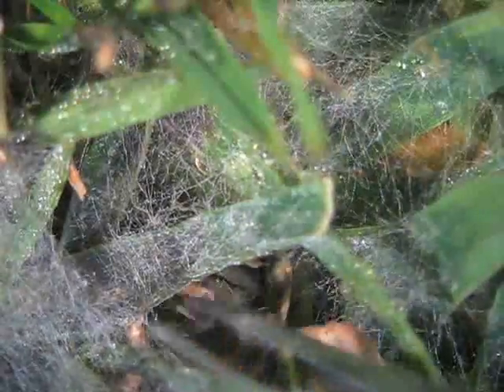Let's get some mycelium on the microscope to see what we can do. We'd like to scoop up some of the mycelium and also take a little piece of leaf tissue with a lesion on it to get a better idea of exactly what's going on.